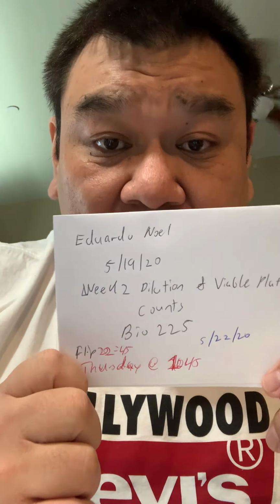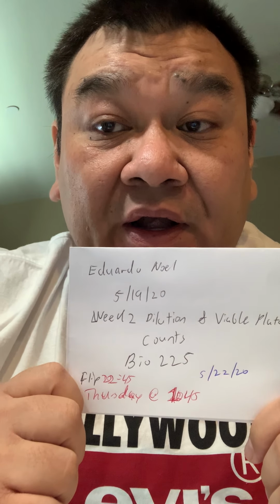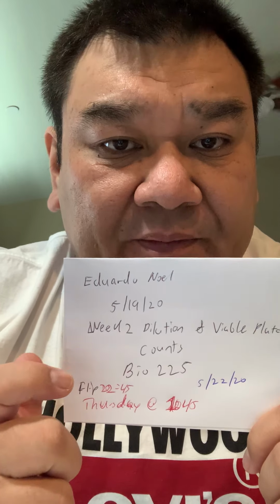This is my video entry for Lab 3, dilution and plate count overview, for Bio 225. It is May 22nd, 2020, and this is the graded portion of the video. Here's my information. I'm using the same card as I used for the experiment to indicate my time, my day, and when my incubation will be completed.